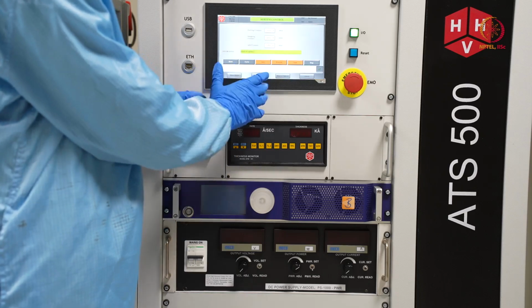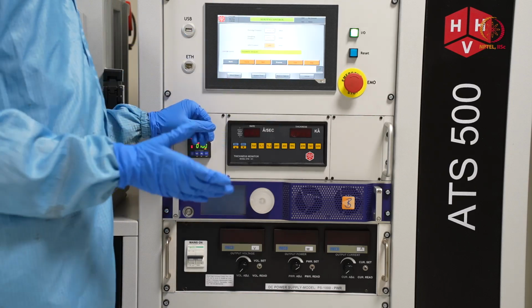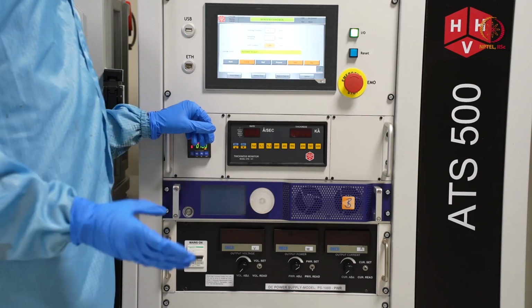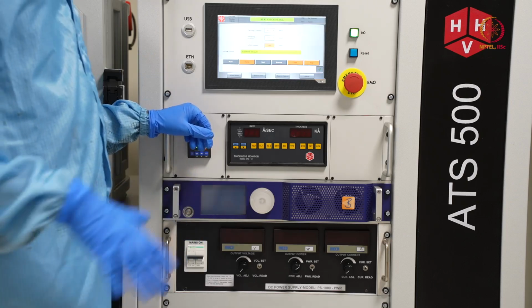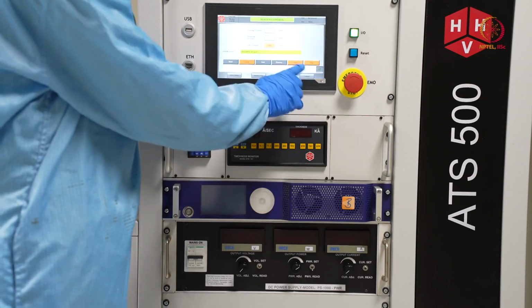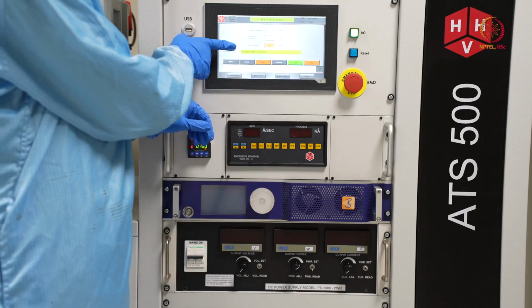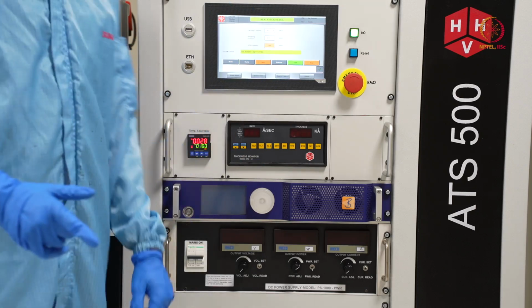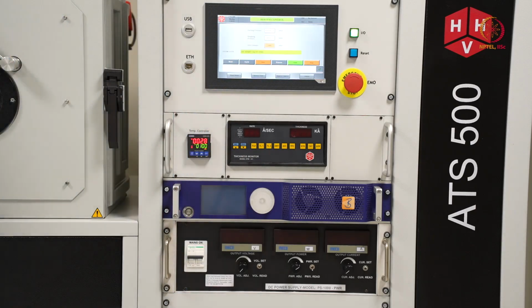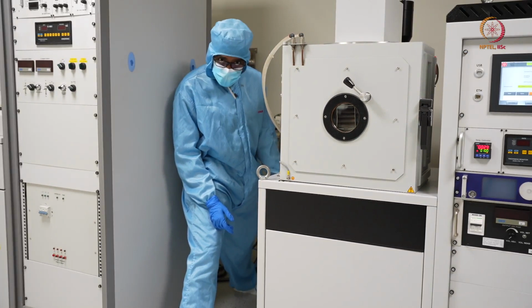For venting the chamber, first we will seal the chamber so that it will be detached from the pump. Otherwise it should be done automatically, but instead of relying on the internal tool things, better you do it by yourself, then you go for venting. As I pressed vent, it is showing chamber vent sequence and then air admit valve open. Probably you are getting the sound also, like air admit valve is open. As we know, air admit valve is here, so through this venting is happening.